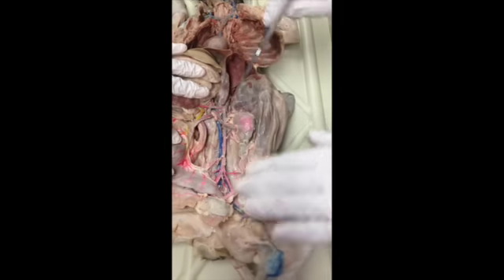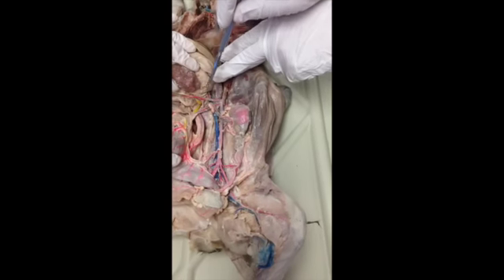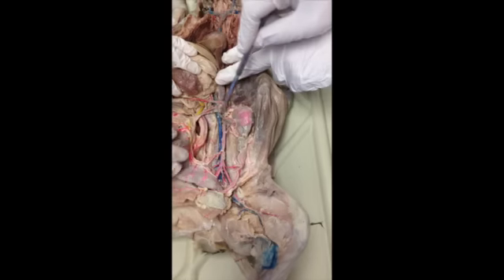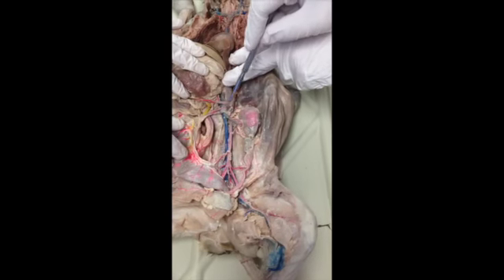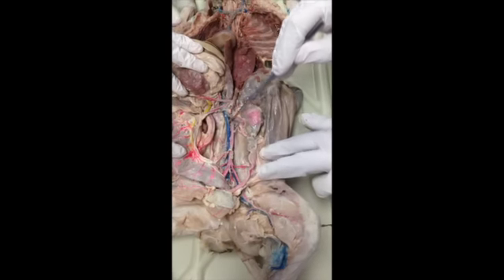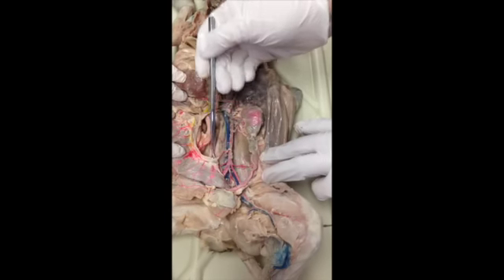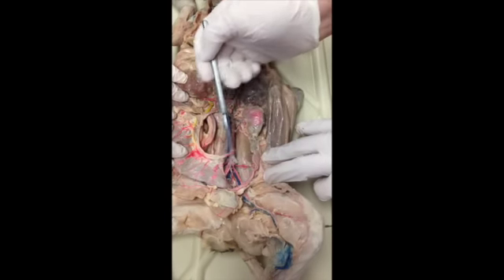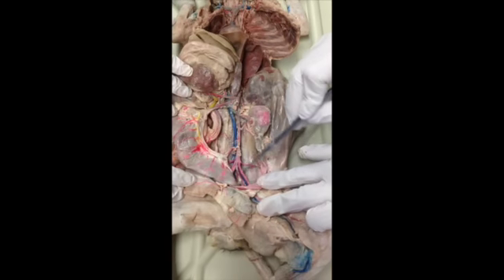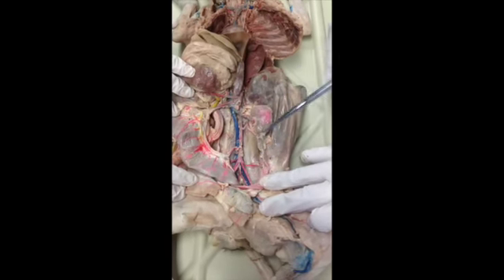So this is abdominal. Coming off the abdominal aorta, you've got three branches, and that's how you know this is your celiac trunk. Right below your celiac trunk is your superior mesenteric artery. And then all the way down here, leading to the colon, and this is your clue, is your inferior mesenteric artery. Okay, so we have an external iliac artery, and we have internal iliac arteries.